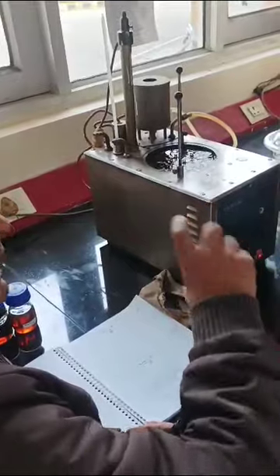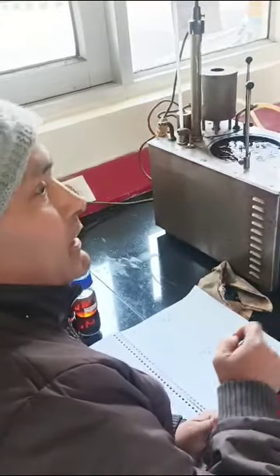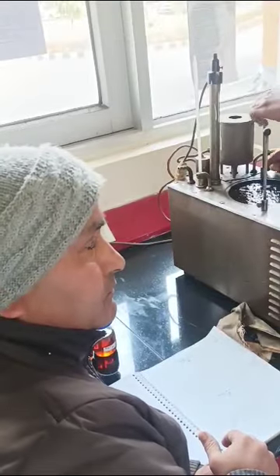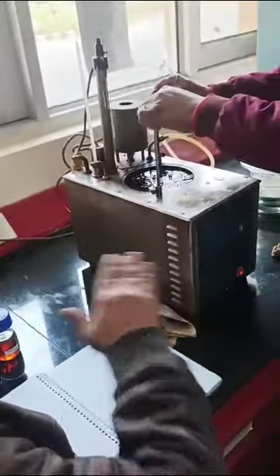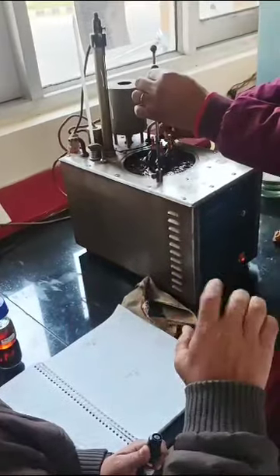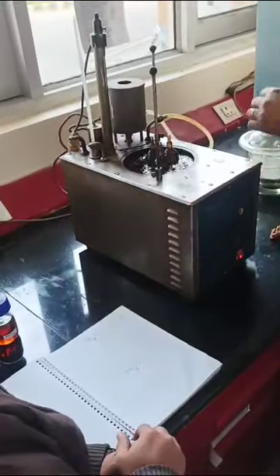When you mix aniline, that sample and normal heptane, you will find layers. So you will have to heat it up to find at which temperature it mixes all together, or when it is separating. The difference between mixing and separating should not be more than 0.3 degrees centigrade. That will be your aniline point.